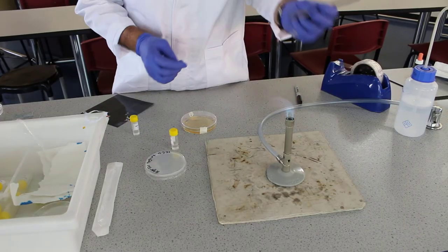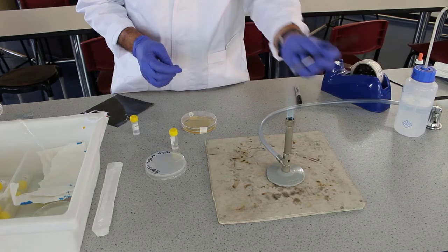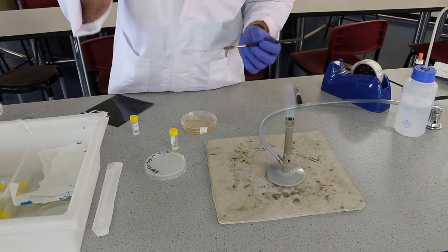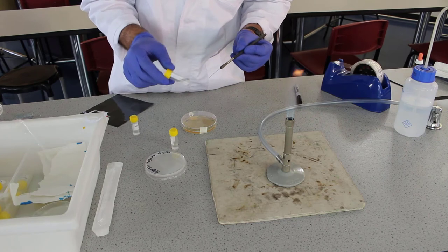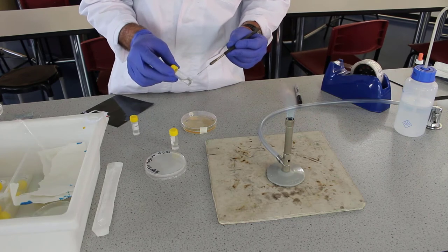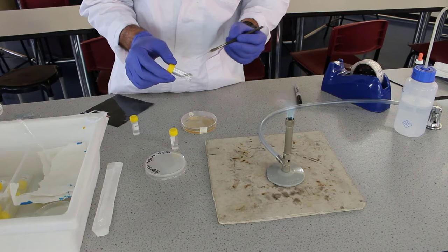Before we move on any further we need to label our vial with a sharpie: student's name, bacteria, and today's date.